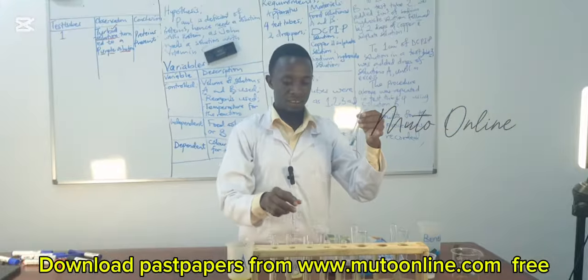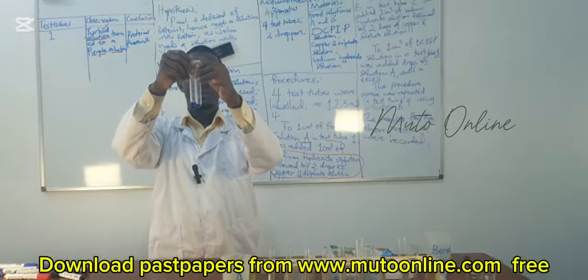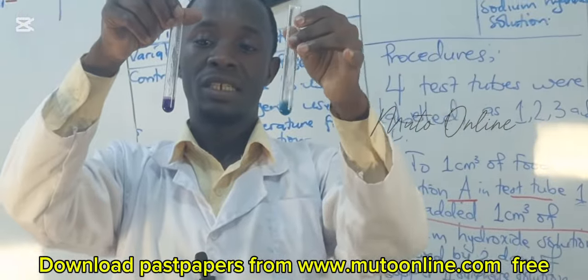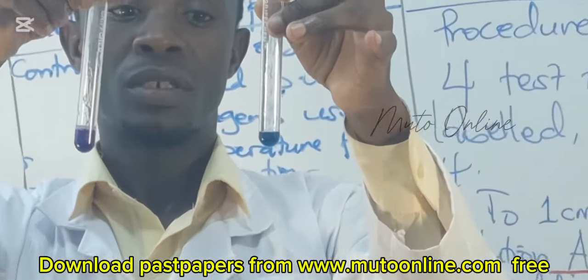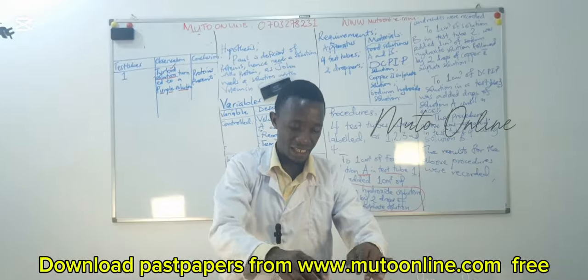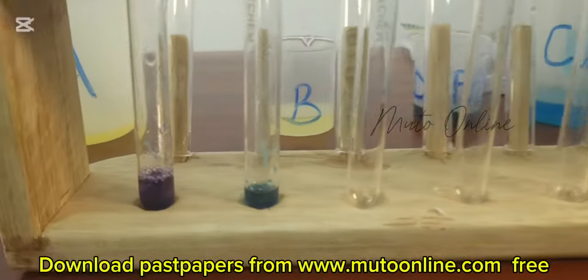And I think there is a difference between these 2 solutions. It is evident: this one is purple, and this one is a blue solution. I think we can see. Previously, the solution was more turbid than water.